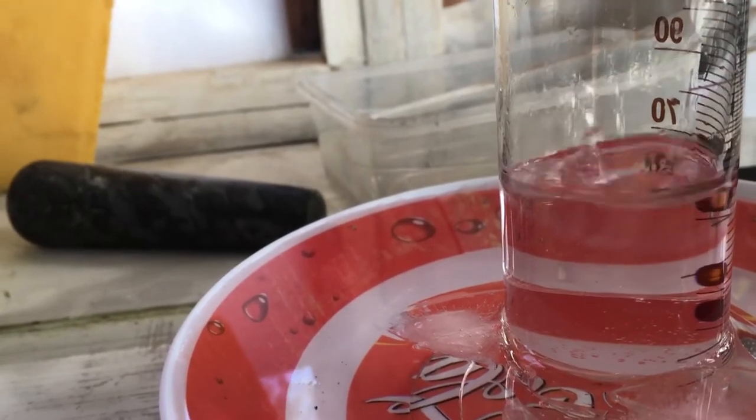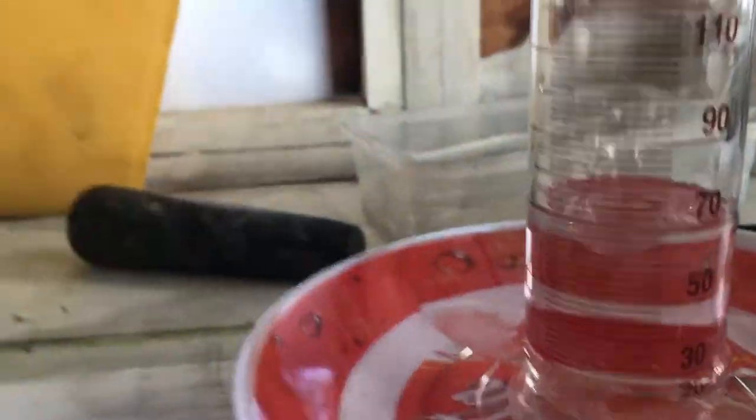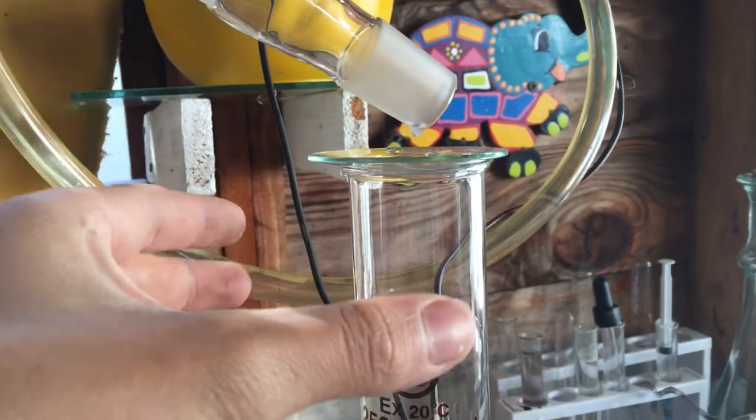It's more ethanol than water. Until I reach my 120ml mark, which is around up here, I'll stop and pour that off. This is really good — look here. If I take some, since it drops a lot, I'll just collect some.